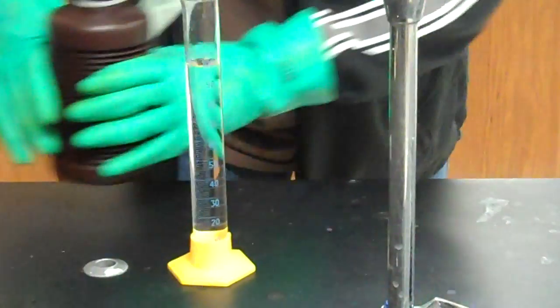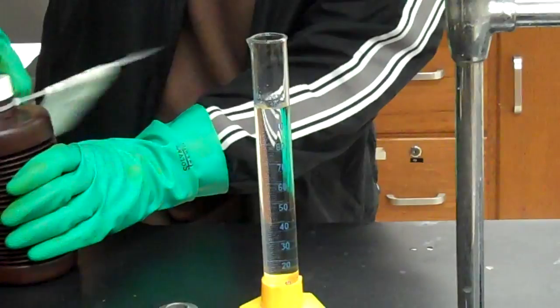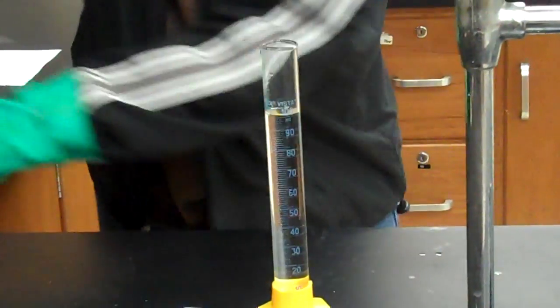Okay, he has his 100 milliliters of hydrogen peroxide poured. Putting on the lid. I'm taking it over to the flask, where we already have 100 milliliters in there.